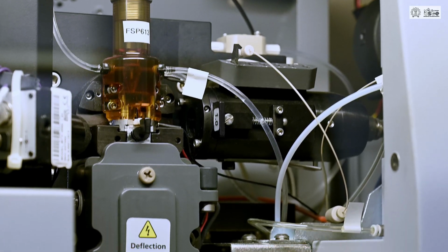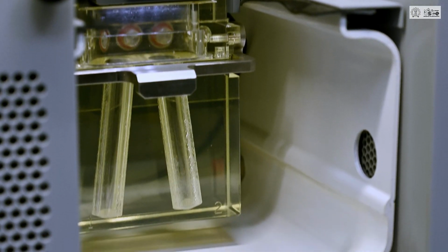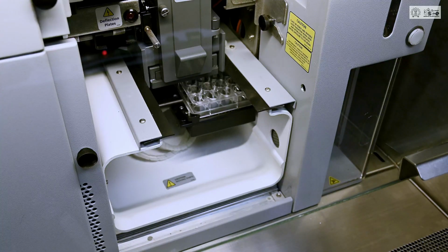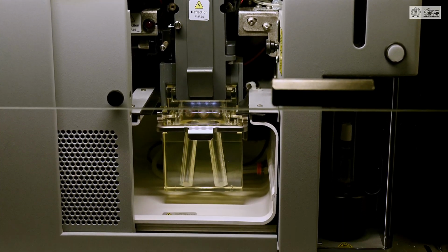The machine has a Class II biosafety cabinet integrated with high-efficiency particulate air, or HEPA, filters to avoid aerosol contamination. It can detect samples with size ranging from 0.2 to 25 microns. However, the team has been able to detect samples smaller and larger than the specified range.